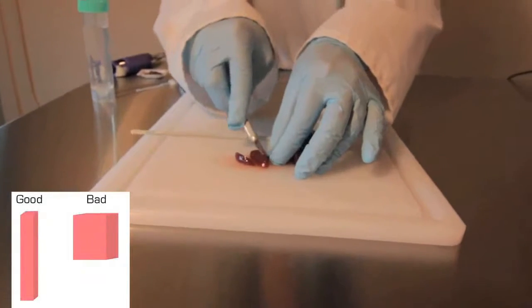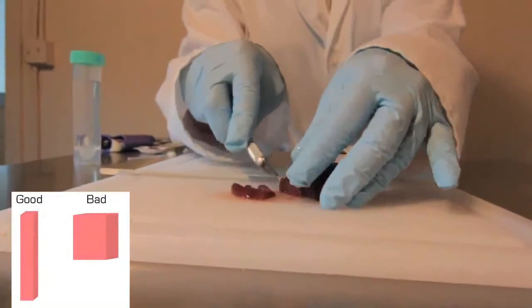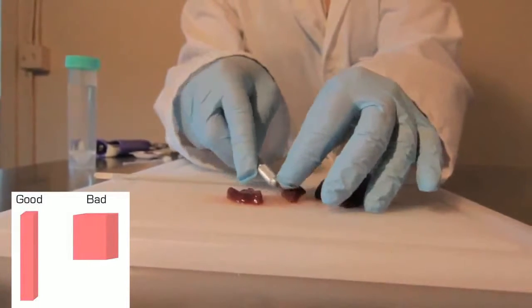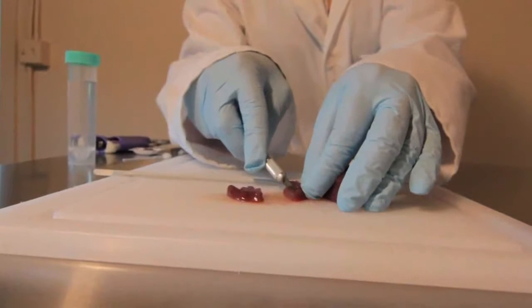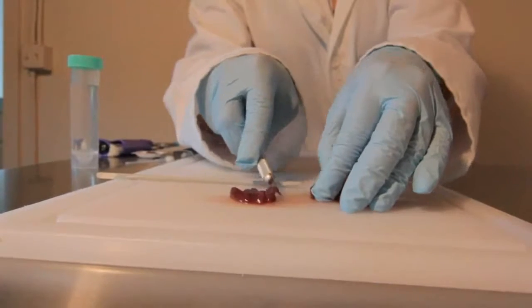When preparing tissue samples for homogenization in the Bullet Blender 5, cut them into long thin strips. This shape will homogenize more efficiently than square or round shapes. If your entire sample is less than 1 gram, there's no need to cut it. You can place the whole sample inside of the tube.